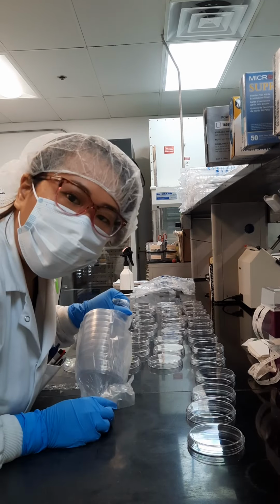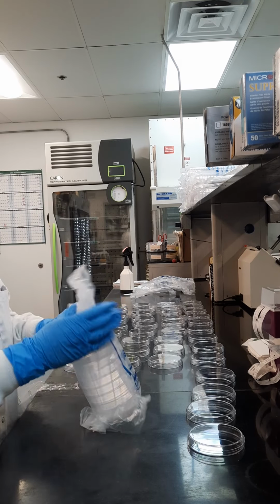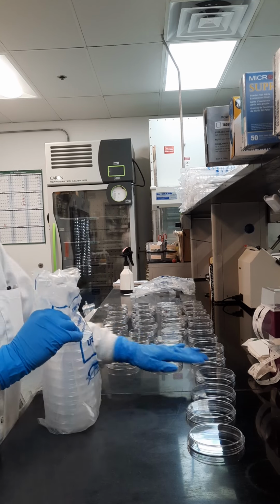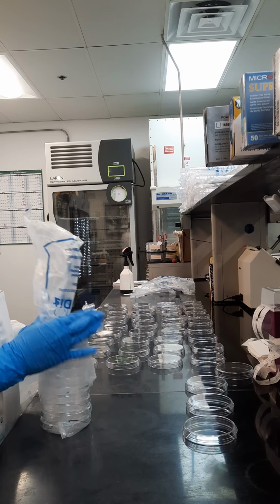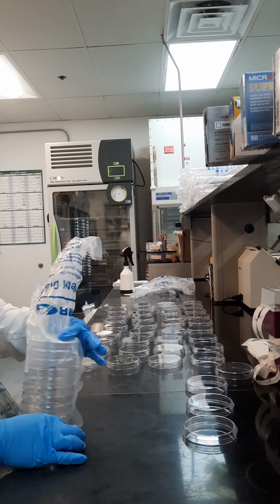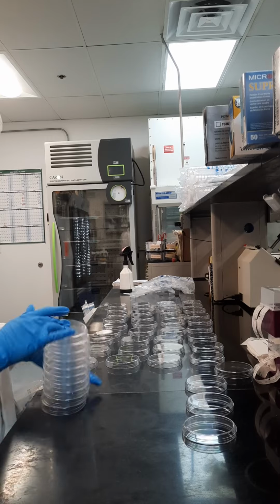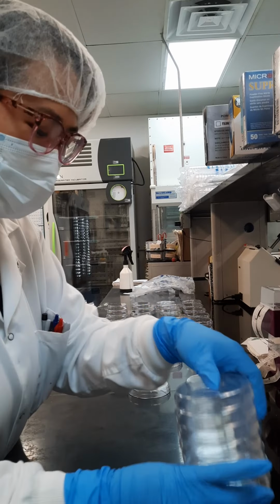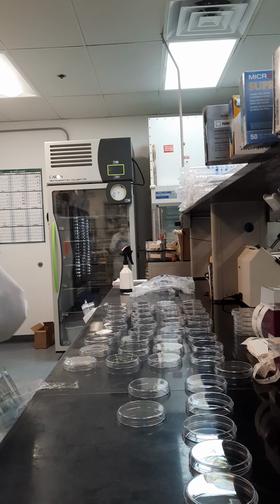Also, for those of you who don't know, all these tests are time sensitive. So you can see why you gotta be fast and accurate as the work goes. Top trash can. I just put the extra piece there.